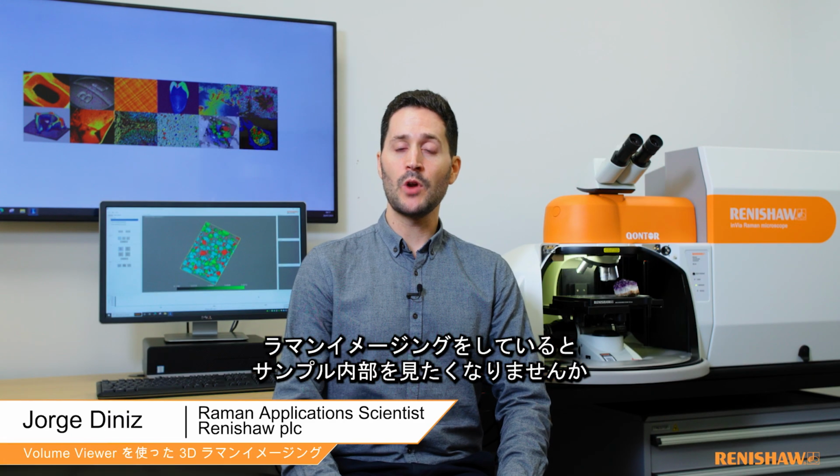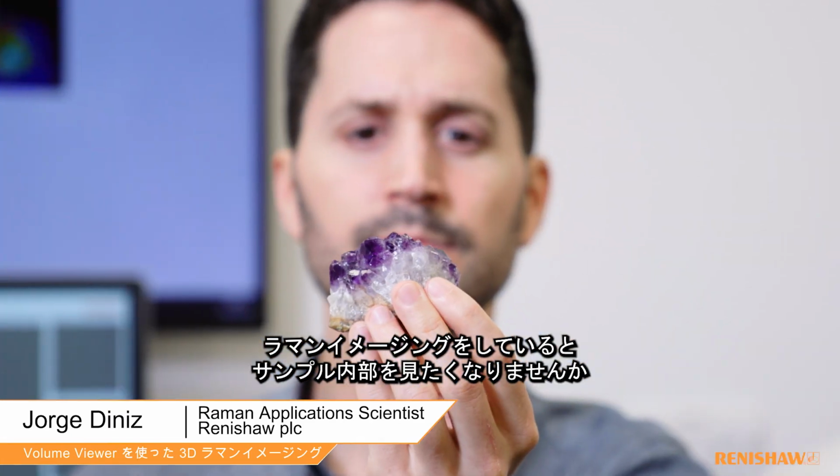Sometimes when generating Raman images, you may wish to look deeper into the surface of your sample.